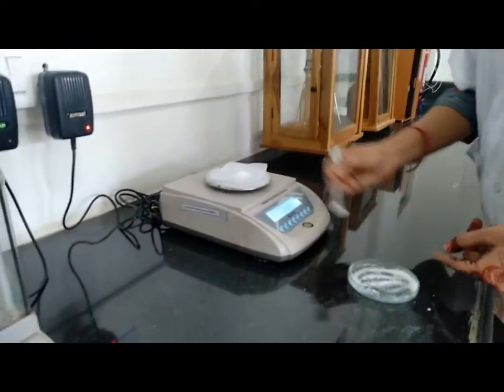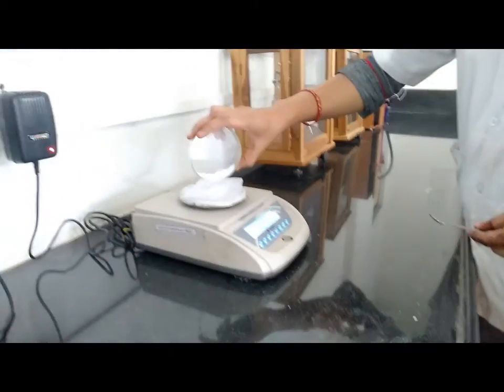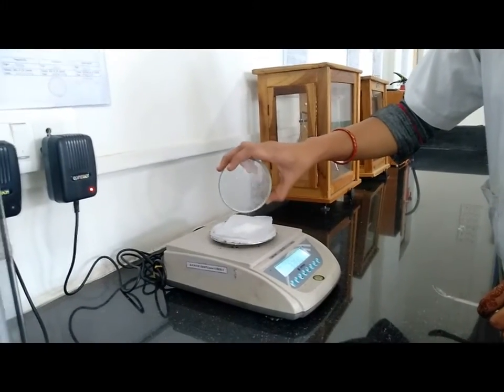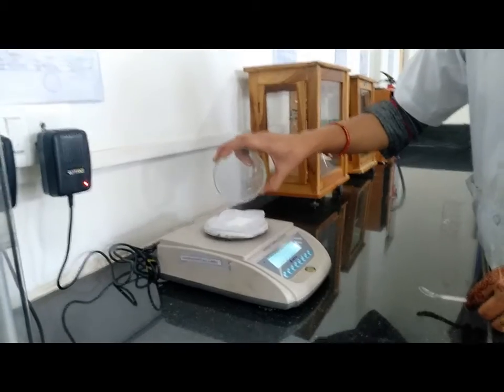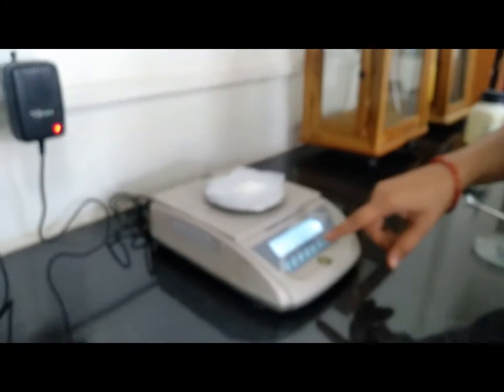We got 3.36 grams of the compound. Now we have to determine the melting point of this substance.